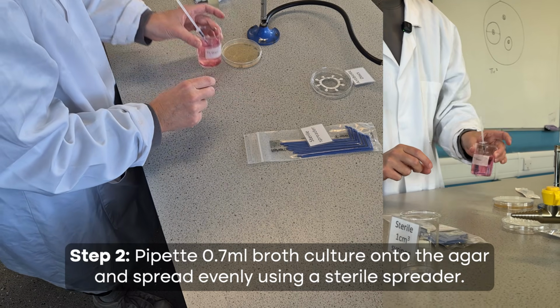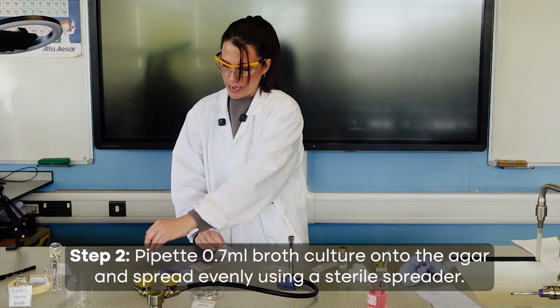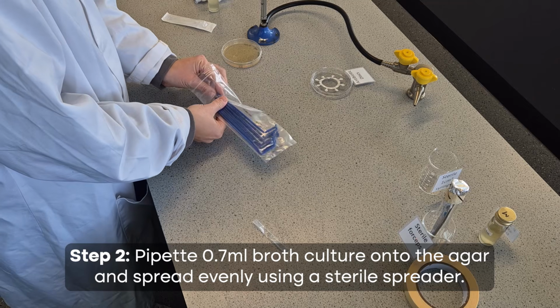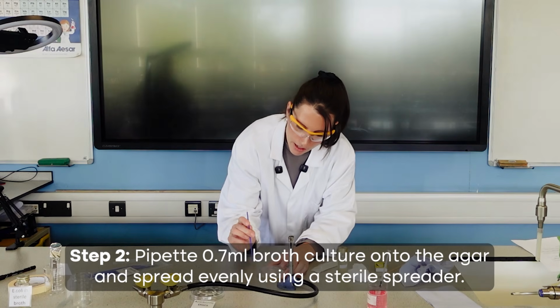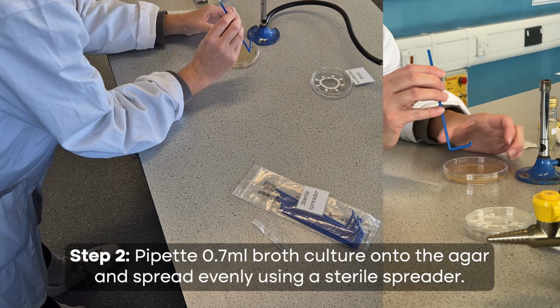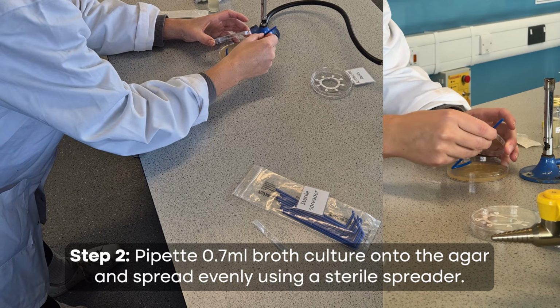students to actually pull the syringe up so it draws the Virkon inside, so it's disinfecting the inside and the outside of your syringe. Next, I need to open these spreaders. We can see it was a sealed sterile pack, so as soon as this is opened, they're no longer going to remain definitely sterile. So again, you want to only slightly open the lid, and you want to be working near your Bunsen burner.